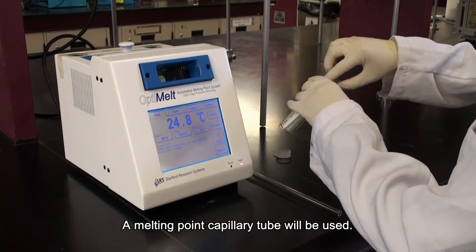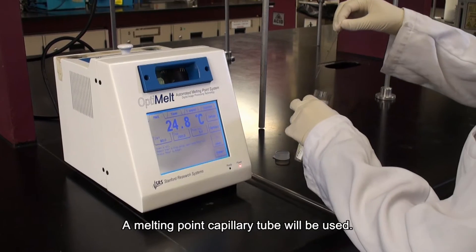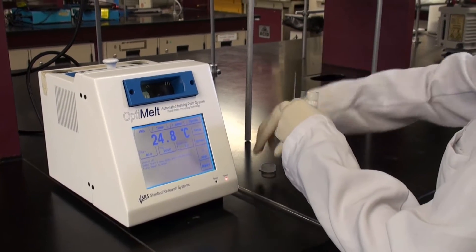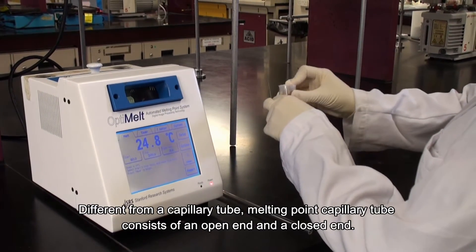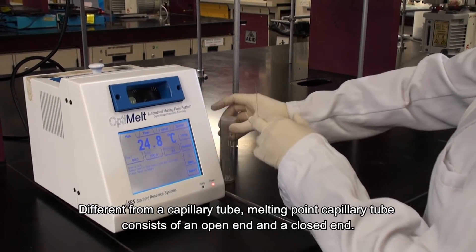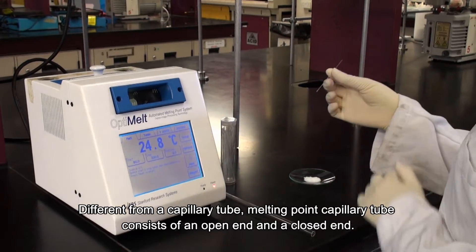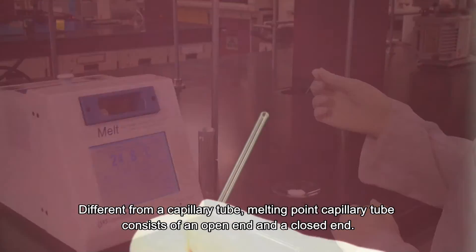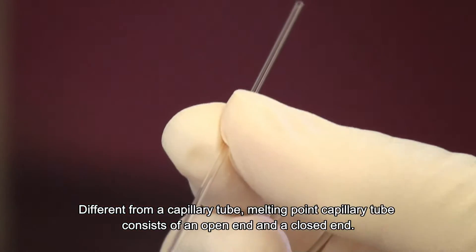A melting point capillary tube will be used. Different from a regular capillary tube, a melting point capillary tube consists of an open end and a closed end.